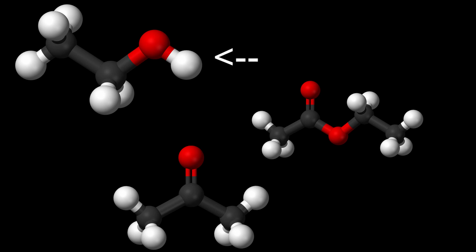The first one is going to be ethanol, which was a pain to dry — I'll explain why later — ethyl acetate, which was much easier, and acetone, which again was much easier.